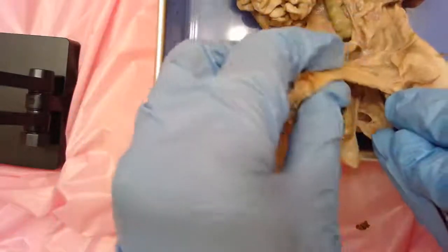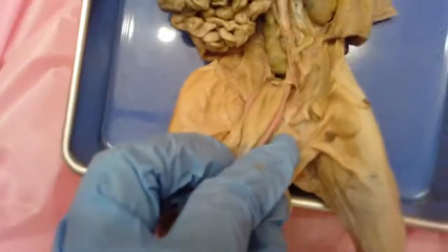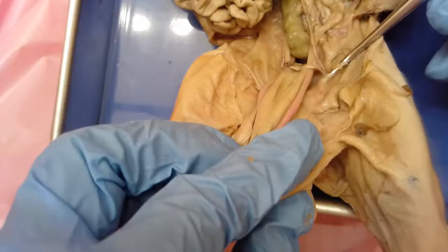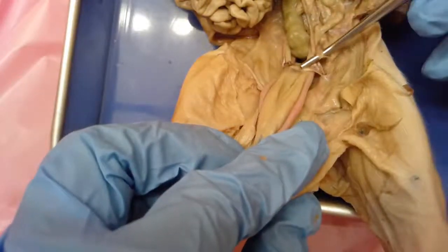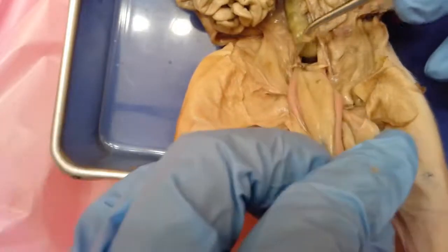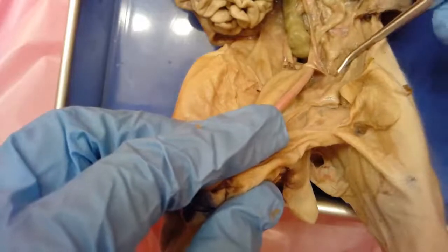This spermatic cord continues all the way up, and if I flip this over you can see where the vas deferens continues internally. Zooming in closer, you can see an opening where the vas deferens enters the abdominal cavity. Here's our vas deferens looping around, and you can see one coming from the other side - from the testes on the other half. This little opening is called the inguinal canal.